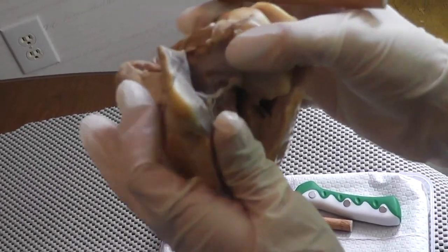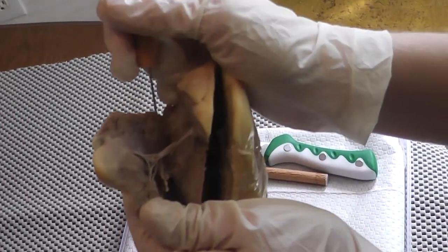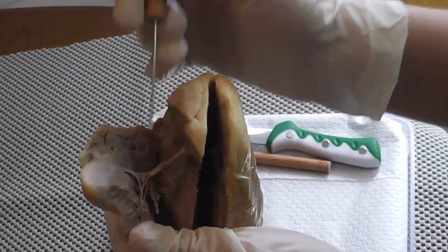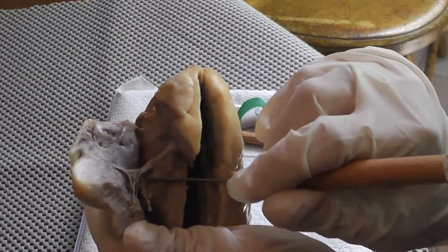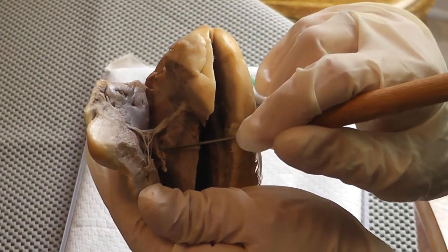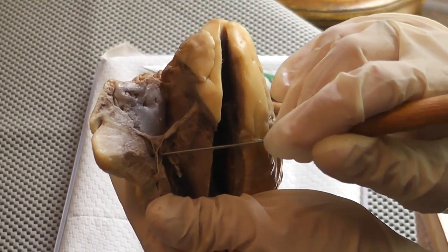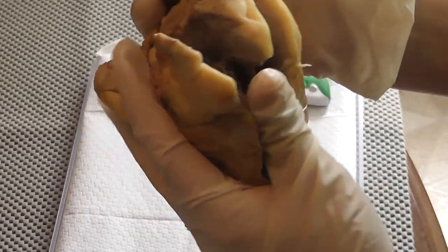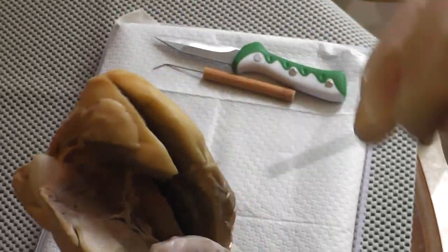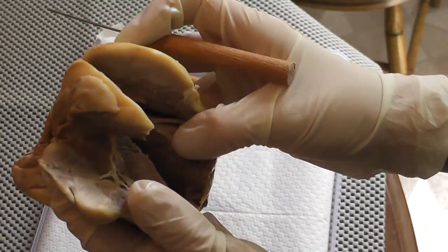If I look over here on the vena cava side, you can see the tricuspid valve. This is a part of the tricuspid valve right here, and there's the cusps. These strings right here are called the chordae tendineae, and they're held in place by the papillary muscles, and these are the papillary muscles right here. I have cut through the right atrium. This portion here is the right atrium, and this chamber here is the right ventricle.